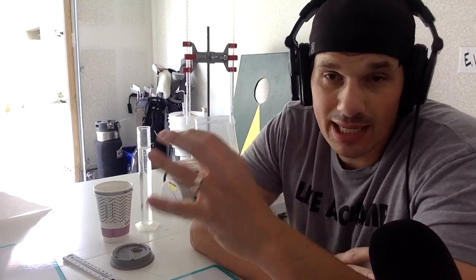Today we're going to be doing a calorimetry lab. So we've been learning about thermochemistry and heat of fusion and just general heat calculations. And today what we're going to do is we're going to determine the heat of fusion of ice or how much energy it takes to actually melt ice.